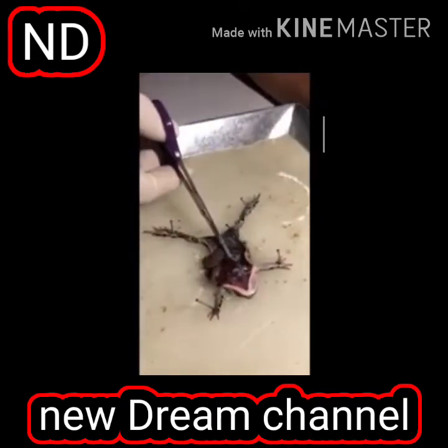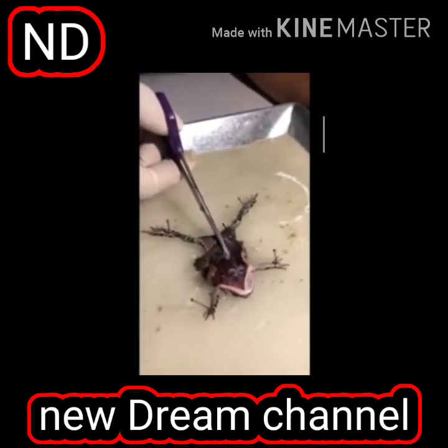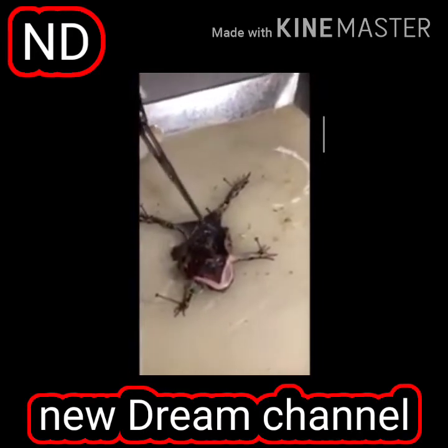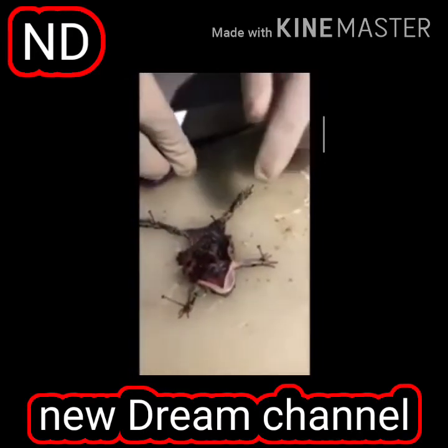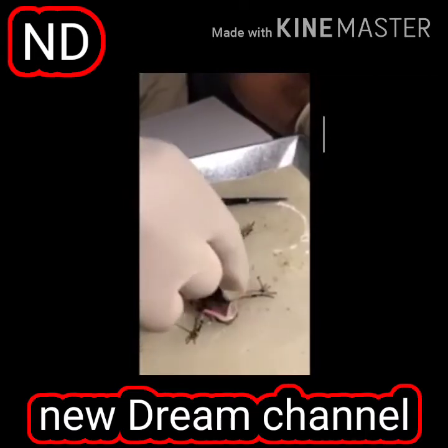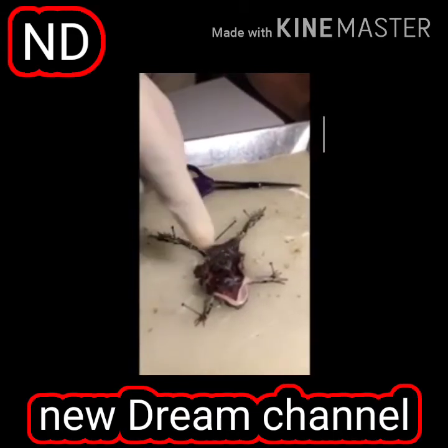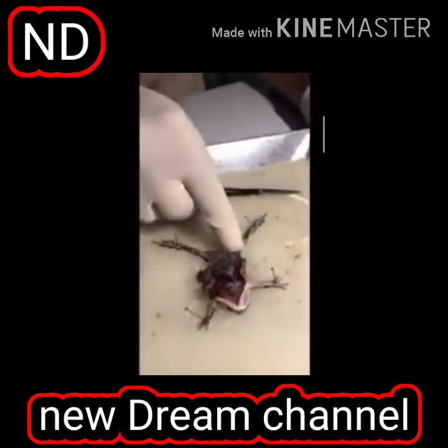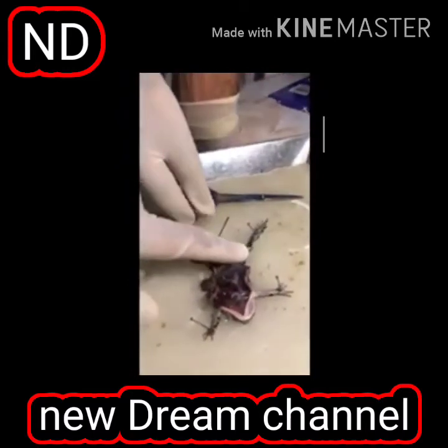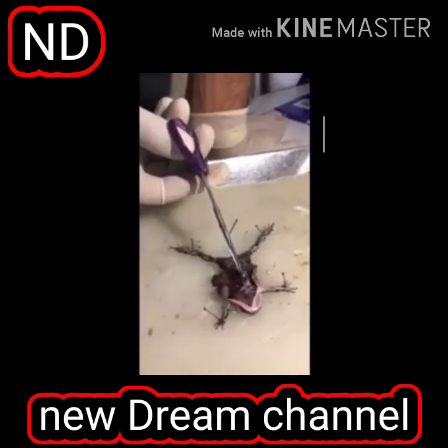This is peritoneal mass. It's not an organ. You can see the backbone here. On the back, these are bones. On the back side, these muscles are very much developed. Why? Because they have to jump, they have to move. The muscles here are not developed. These muscles are very much developed, and when it jumps very high, it is because of these muscles. So these are hind limbs, and you can see the heart beating as well.